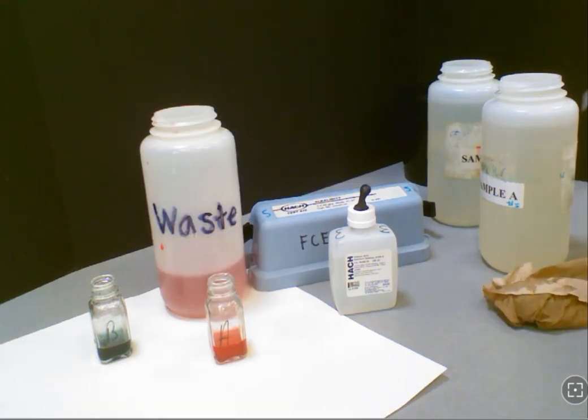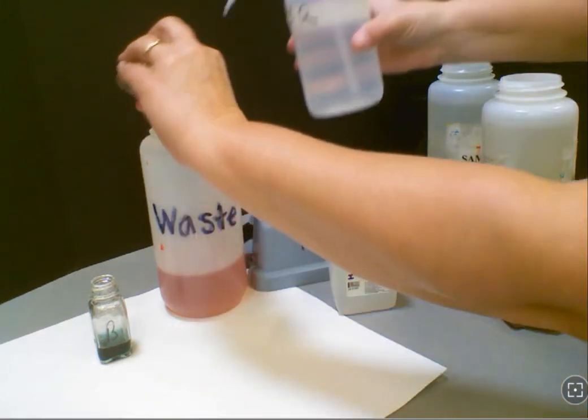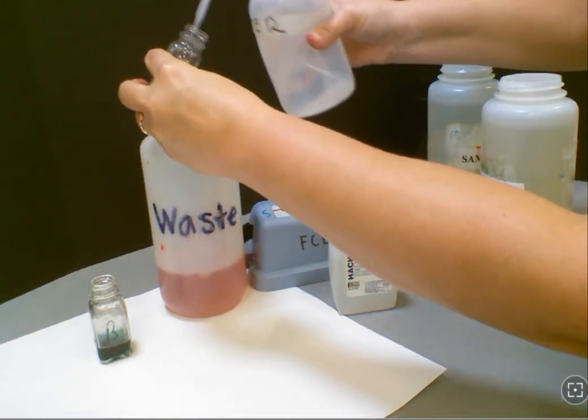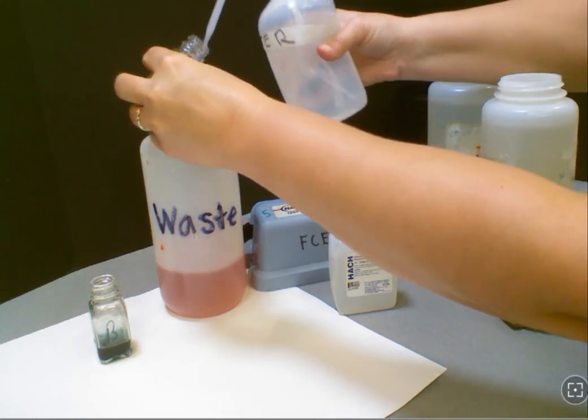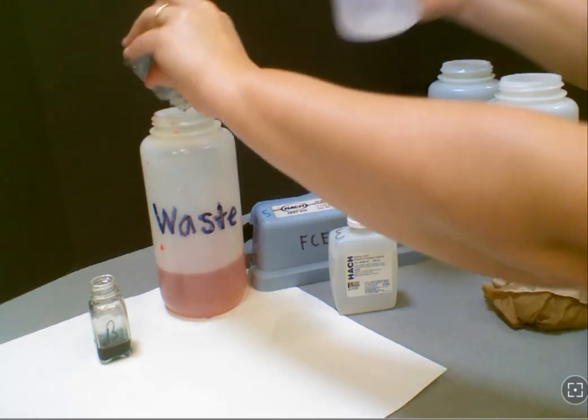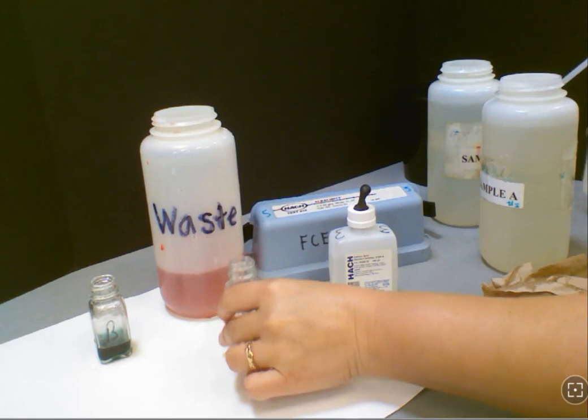A reminder, when you're finished, please be sure to pour all of your chemically treated samples back into the waste container and collect any leftover wrappers to be thrown away in the trash can. And then return everything to the container as you found it prior to the lab.